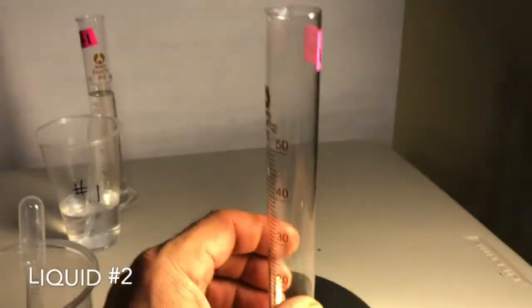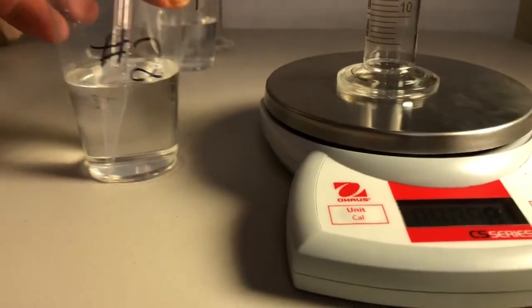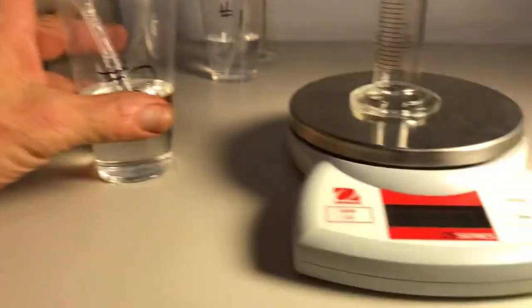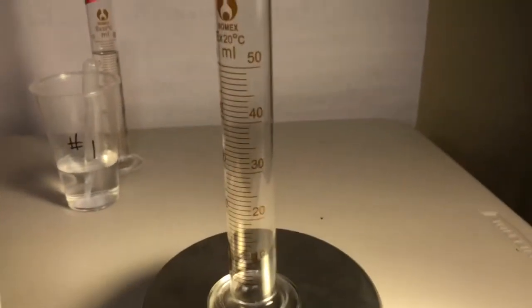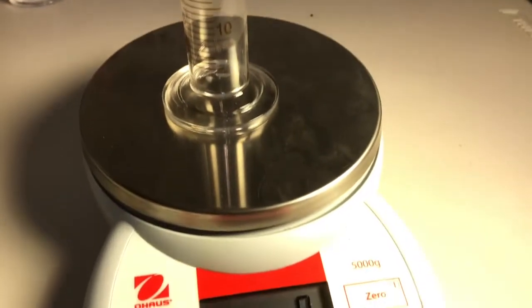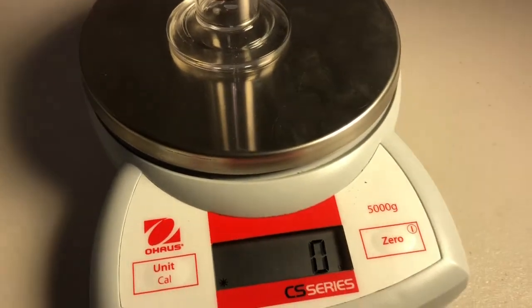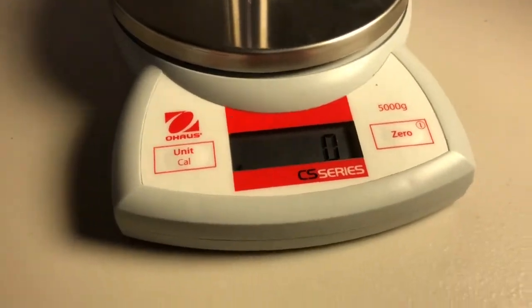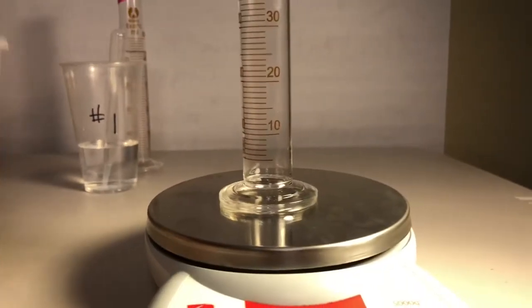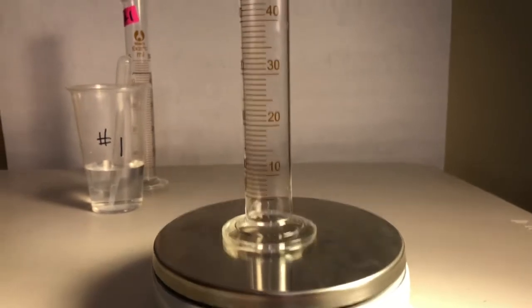All right, pathways. Here comes crazy old 2 at you. Same setup, same process, different liquid. Kind of looks the same, but you'll notice it's not at all the same. Make sure that thing says 0. Oops, wrong way. Data set 2, it does. So I've zeroed out, those two pieces of glass were the same weight. Still says 0. All right, so here comes data point number 1.